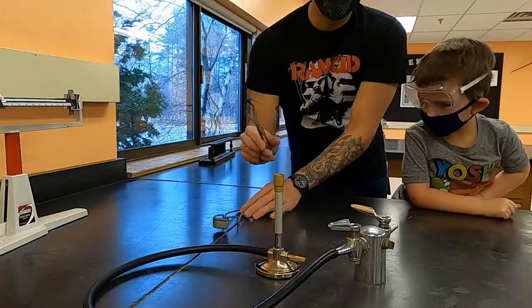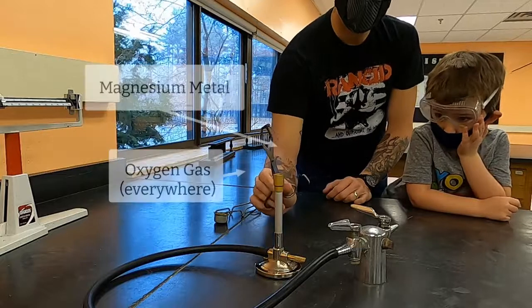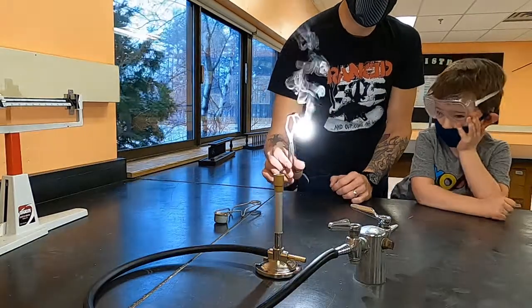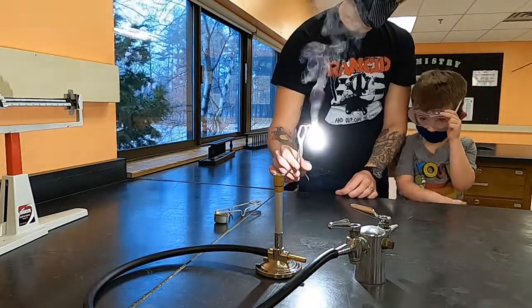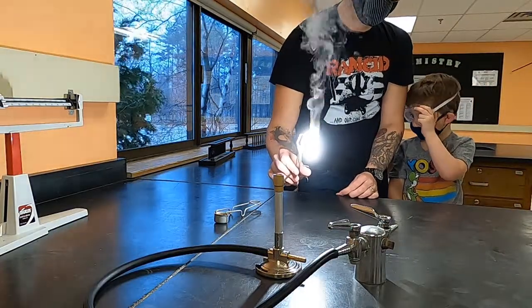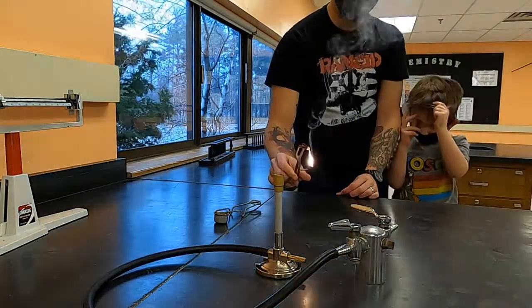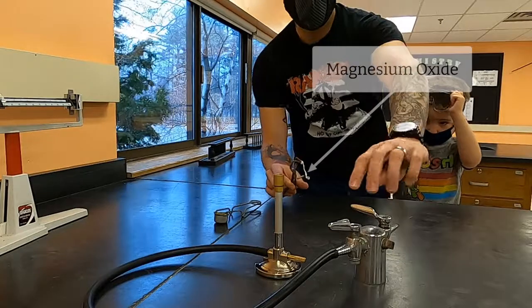You need to make sure that the flame is as hot as it can get and put just the tip of the magnesium metal into the hottest part of the flame. Once it starts to ignite, you can remove it from the flame and the reaction will sustain itself. The product is magnesium oxide at the end.